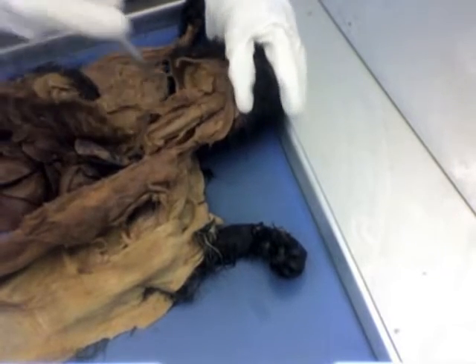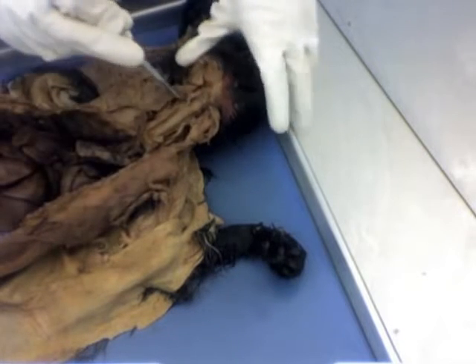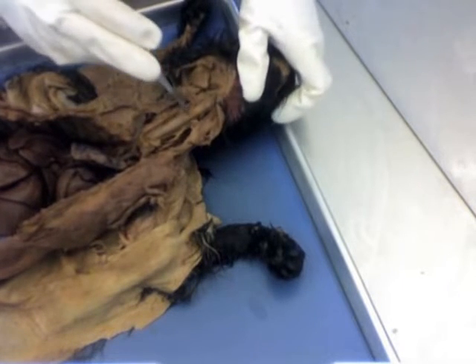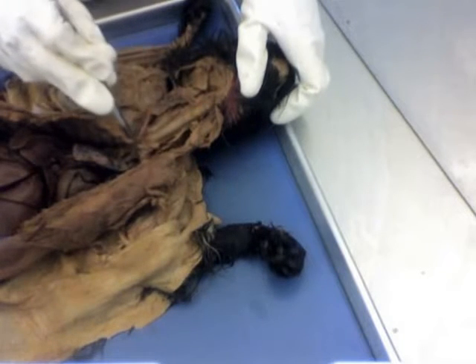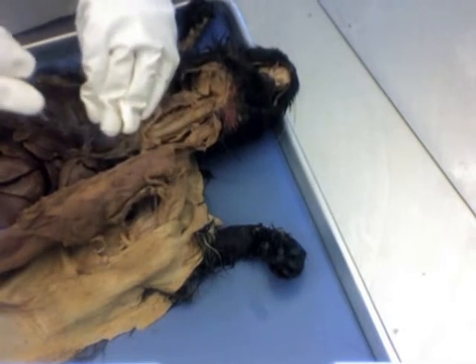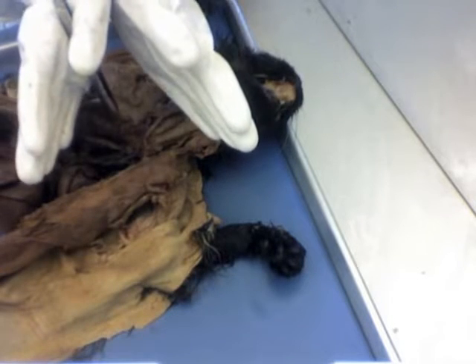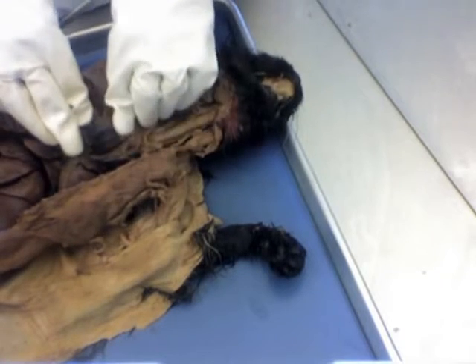And finally, the thyroid cartilage, you can see just around the larynx there, those rings of cartilage there. And of course the trachea traveling all the way down from the larynx into the lungs eventually. It's very difficult to see this clearly on the cat, but the trachea will come down and it's going to branch off, one to the right, one to the left, for the lobes of your lungs on either side.